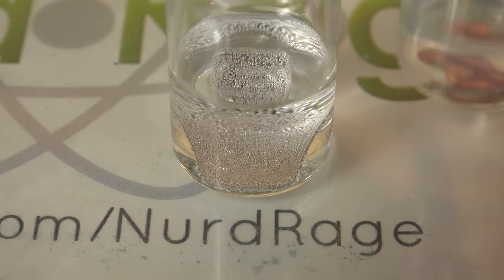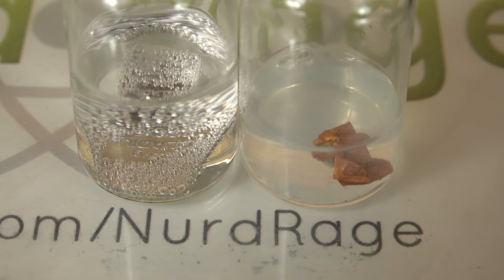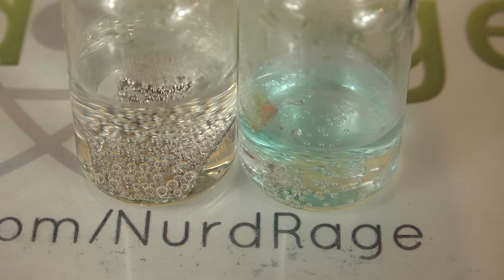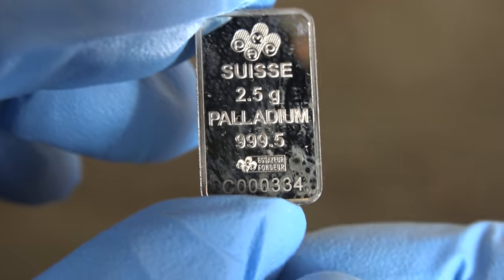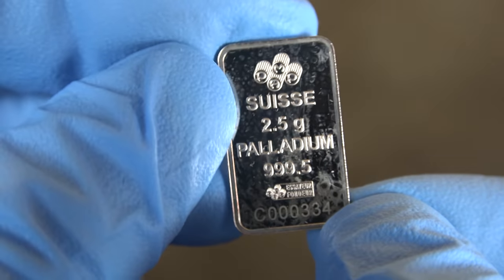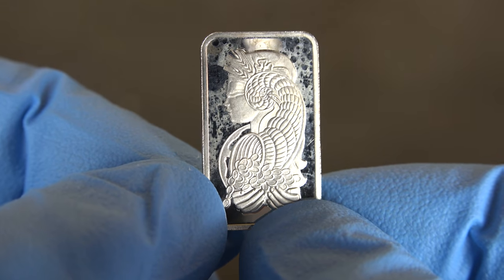Moving on, let's try hydrogen peroxide and sulfuric acid. And I'm also going to compare it with copper metal. Right now we have 3% hydrogen peroxide and now I'm going to add in sulfuric acid. We get a very strong oxidizing acidic solution. It's not piranha solution exactly since we have more peroxide than sulfuric acid, but it should still do some damage to metal if the metal can be damaged at all. As you can see it's reactive enough to dissolve copper, which normally doesn't dissolve in sulfuric acid. I left it in for an hour before pulling it out. And this time we're getting something — we can see some damage on the surface as the solution attacked the palladium. It's not very much though, but it's there. I checked the mass and it didn't change, so maybe we didn't really dissolve the metal but just oxidized the surface. I'm still thinking of the implications but maybe this is good to know and might be applied to cleaning or reactivating dirty palladium catalysts.